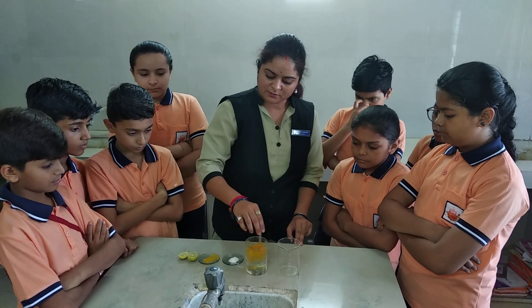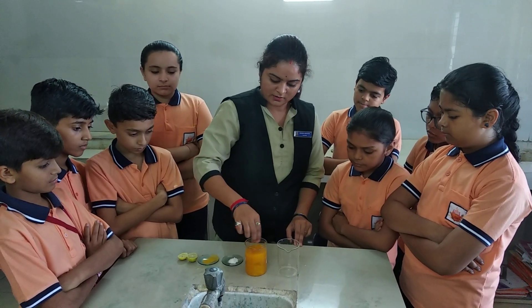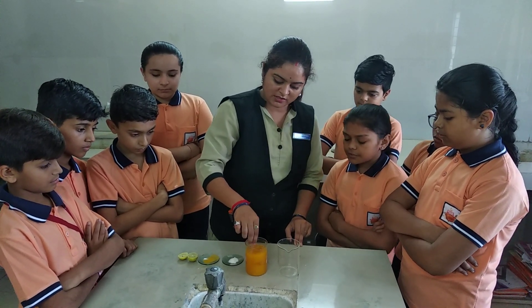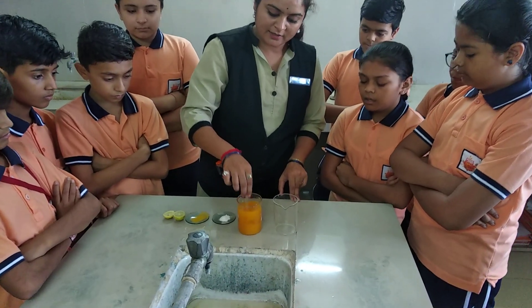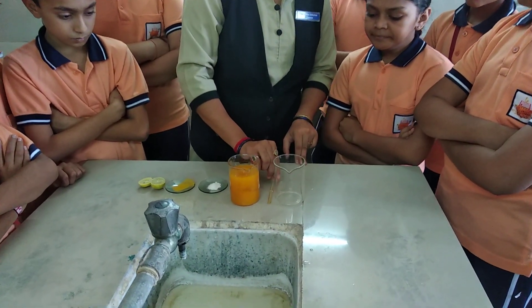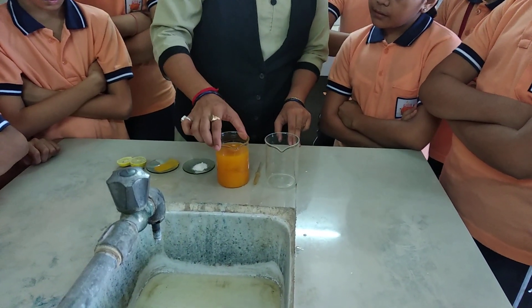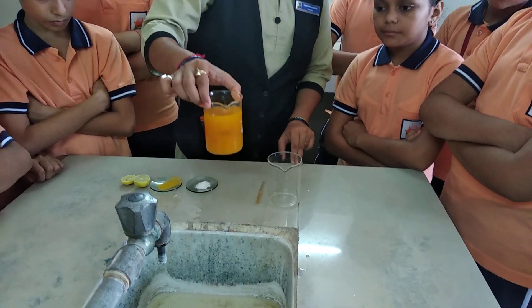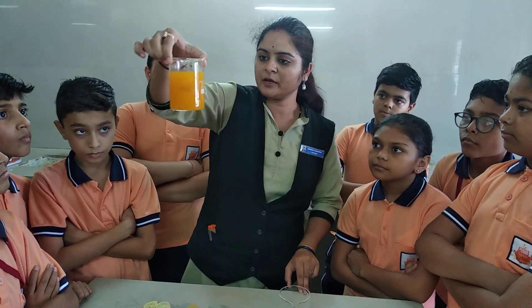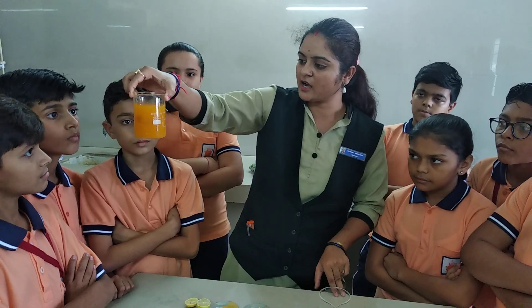Then you have to stir this mixture. After adding turmeric powder, you can see the turmeric particles are moving around.